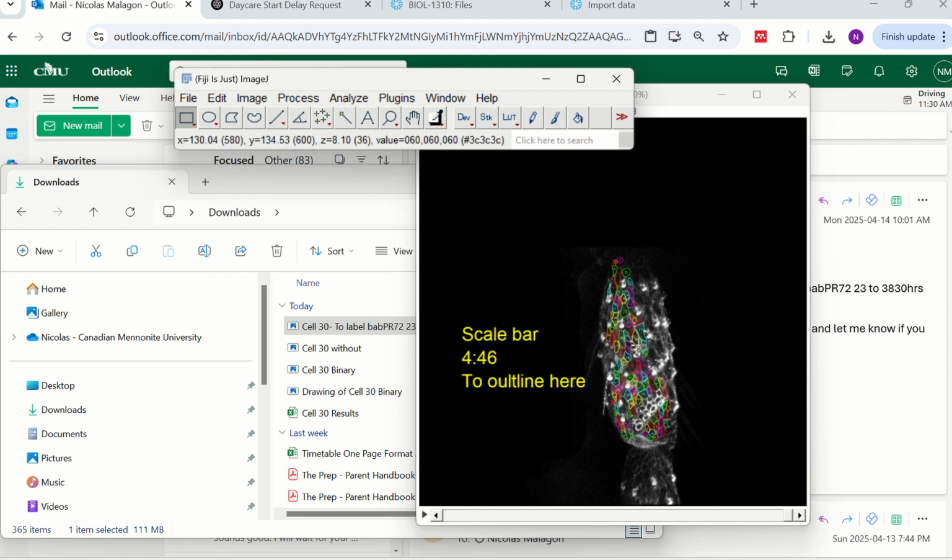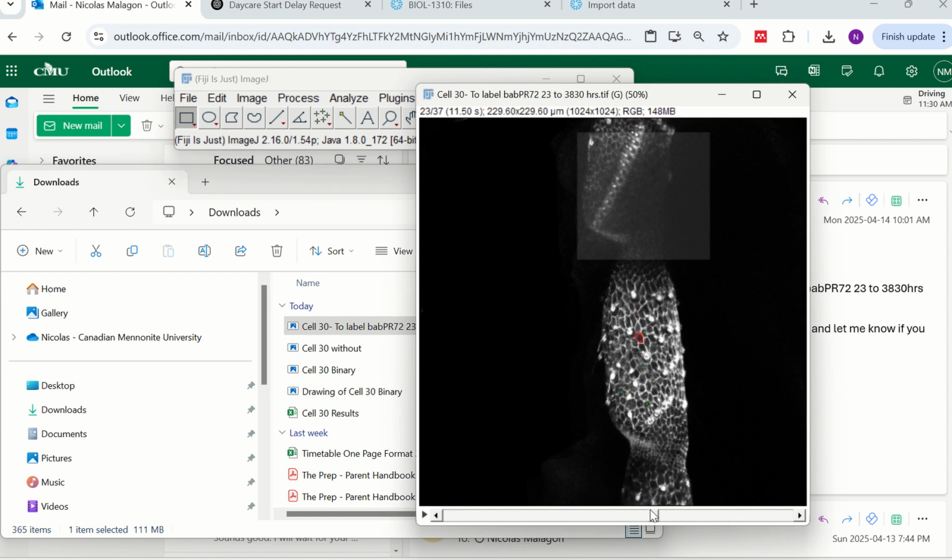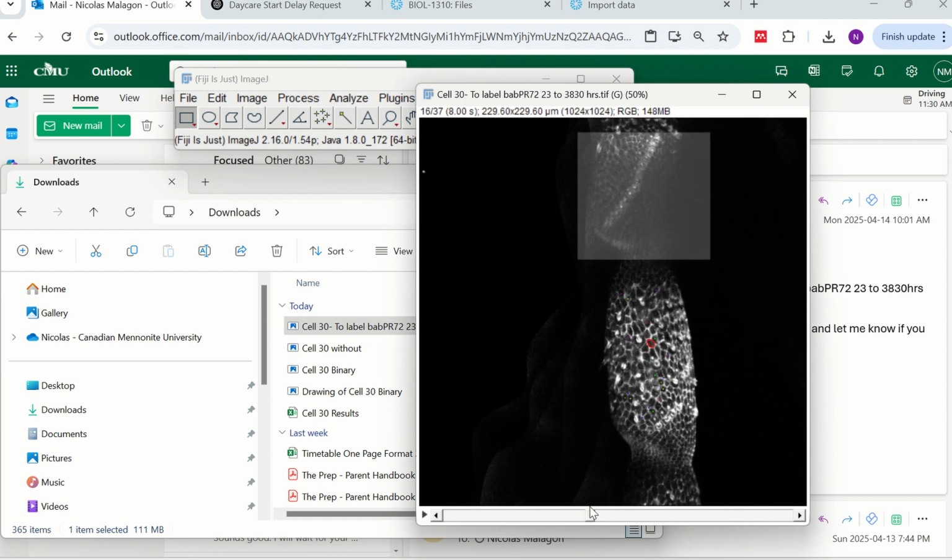somebody already labeled this in a beautiful way for you. And look, it looks amazing. However, here we have one small problem. Not a problem, a different challenge. That is that here we are not working with green outlines. We're working with white outlines.